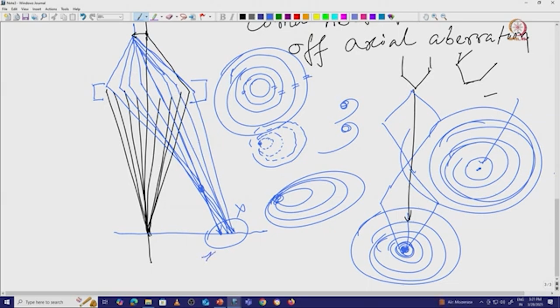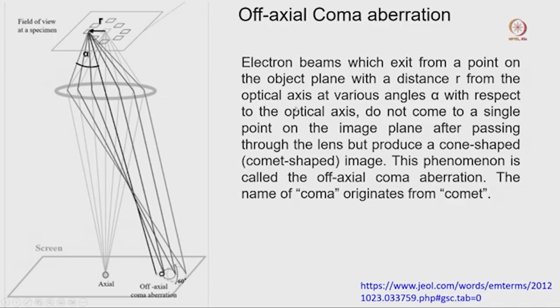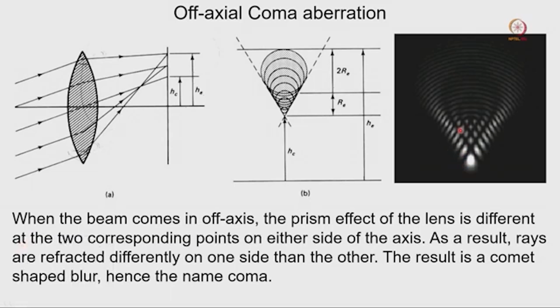Let's take a look at how this coma aberration looks. It will be better to show you in an image. Here if we go to our power spectrum, this is our astigmatism. Now this is the off-axial coma aberration, and when there is a coma aberration, your coma shape will be spread like that, the electron beam. If you look at this spread, the spreading is starting from one particular edge. This edge may be this or that side, but it is not coming from the center. Whenever you try to spread the beam, the beam will start from one particular side.